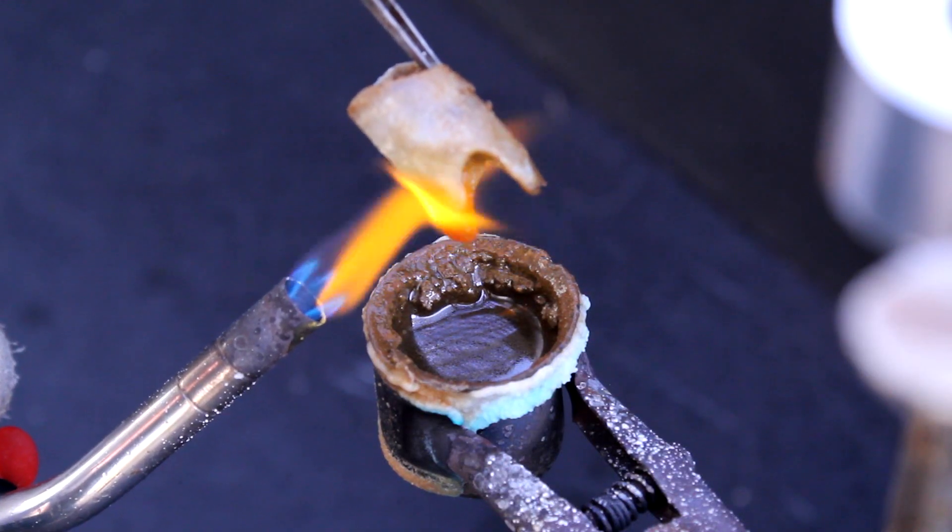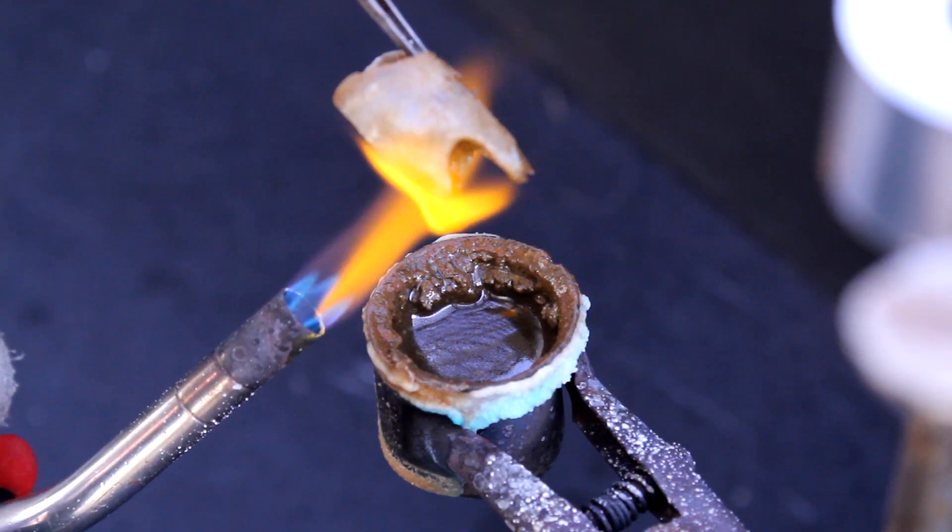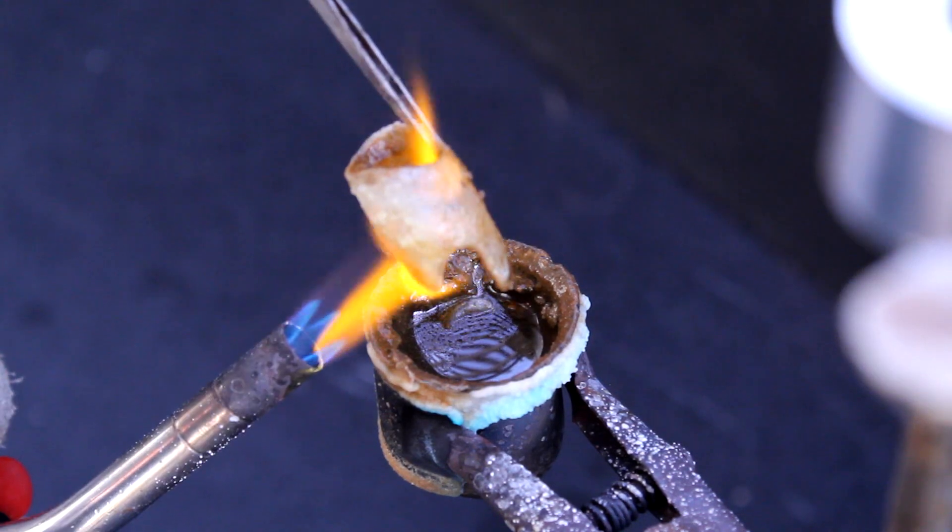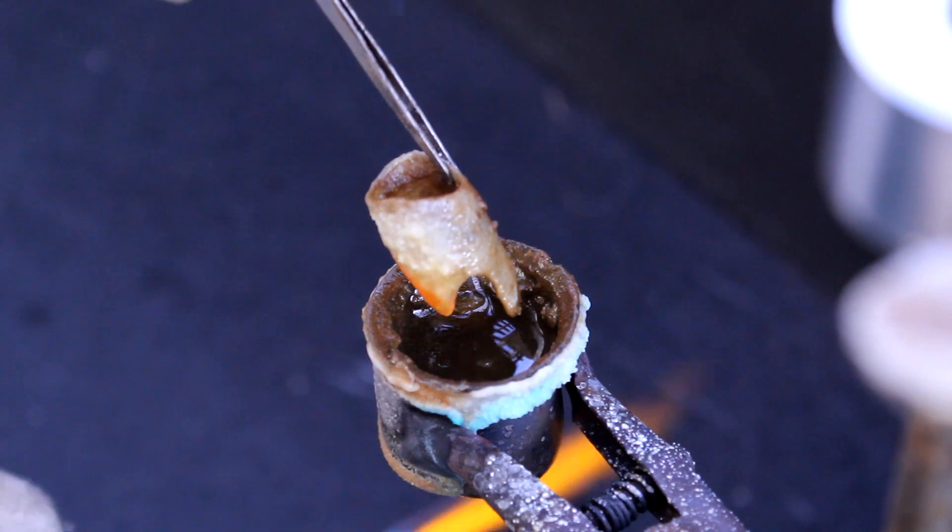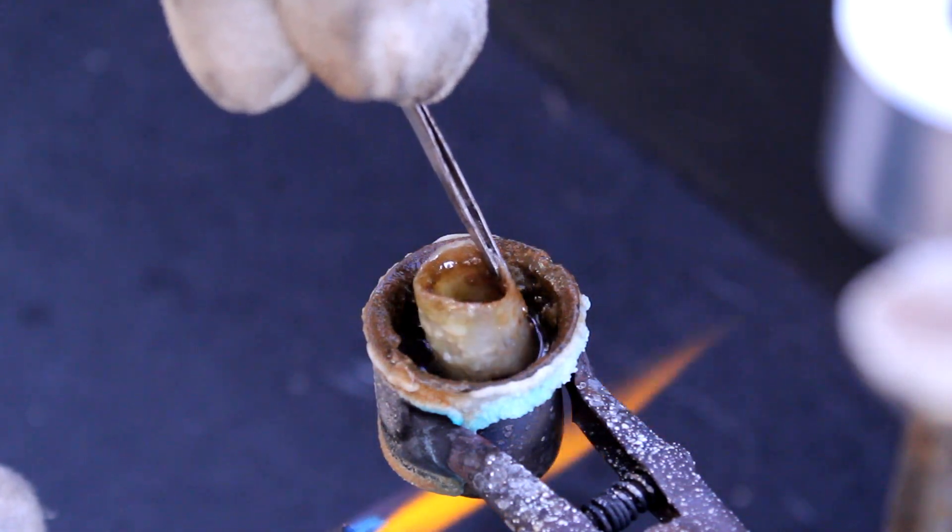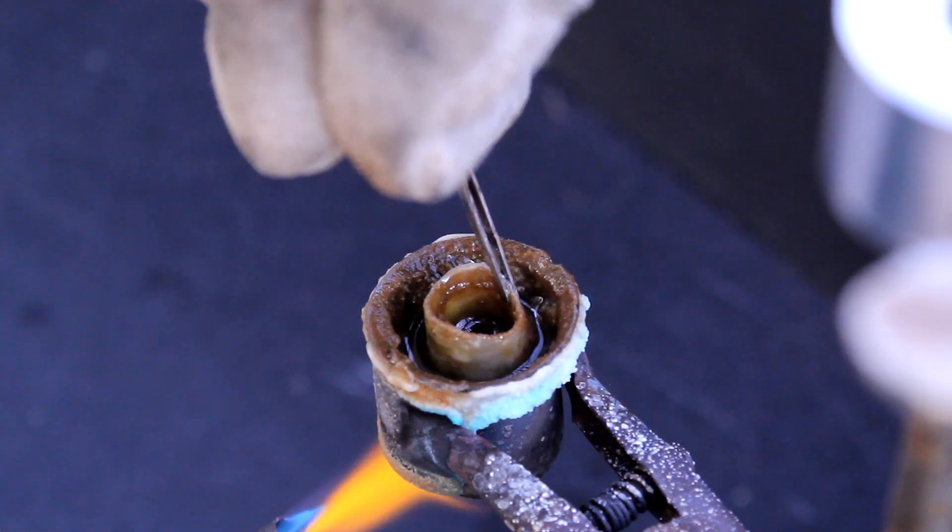You can see here the effects of sodium hydroxide on the melting point of glass. By heating the glass while it's covered in sodium hydroxide, it's actually possible to melt it with my torch into a runny liquid. Now since the reaction to produce sodium silicate proceeds faster at higher temperatures, I use this effect to my advantage to help things dissolve faster.